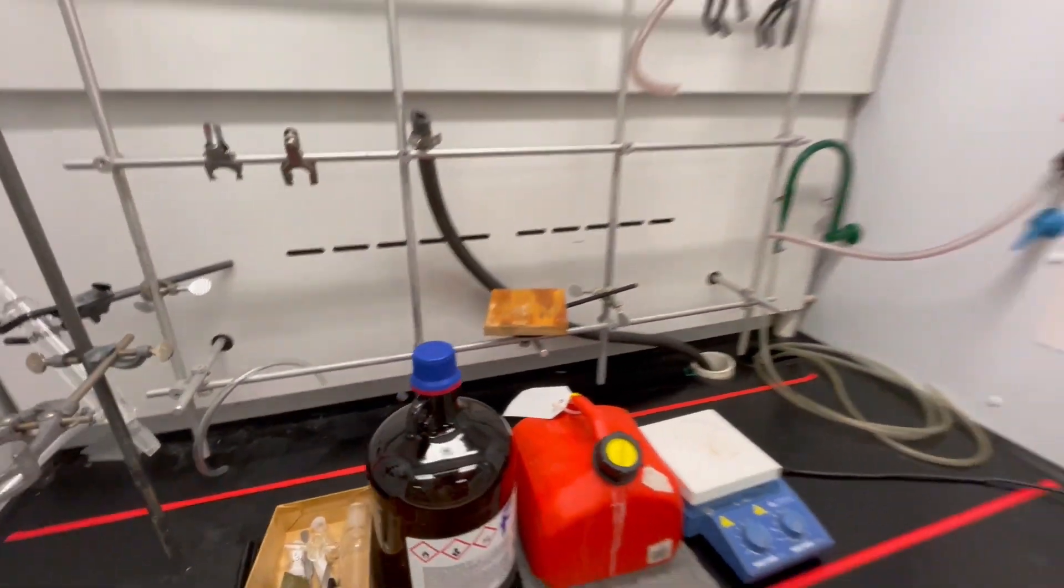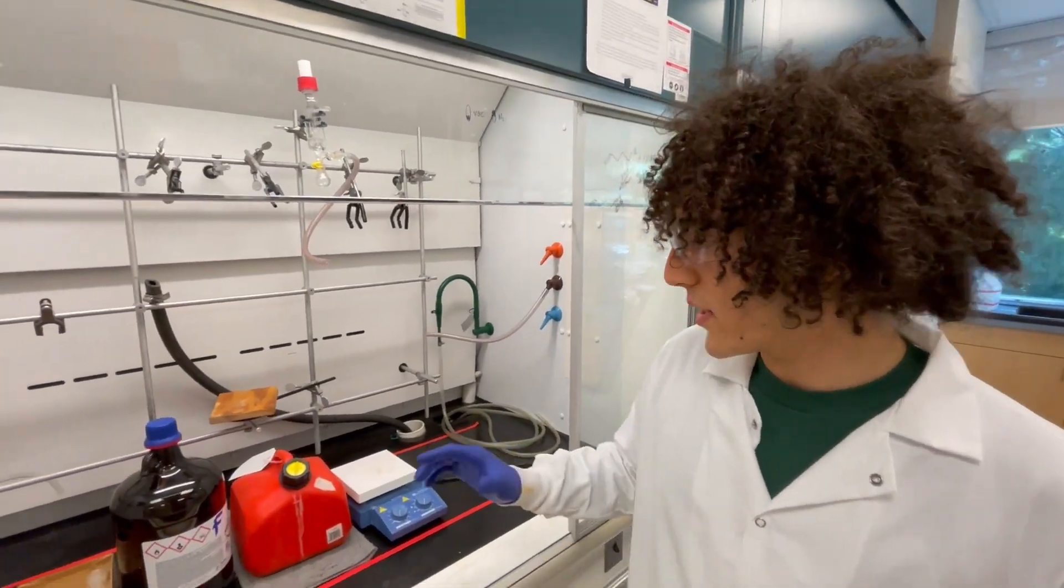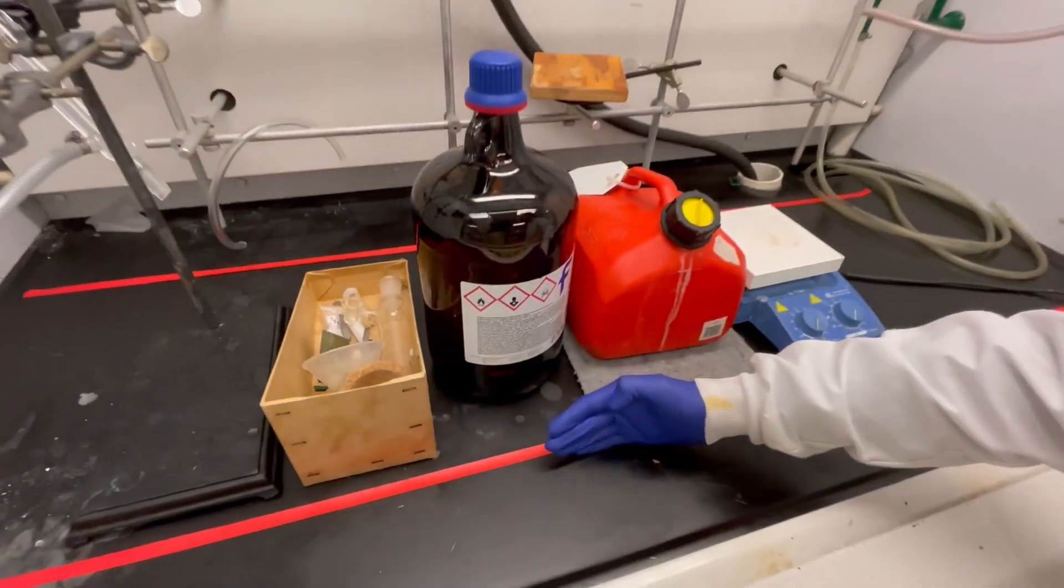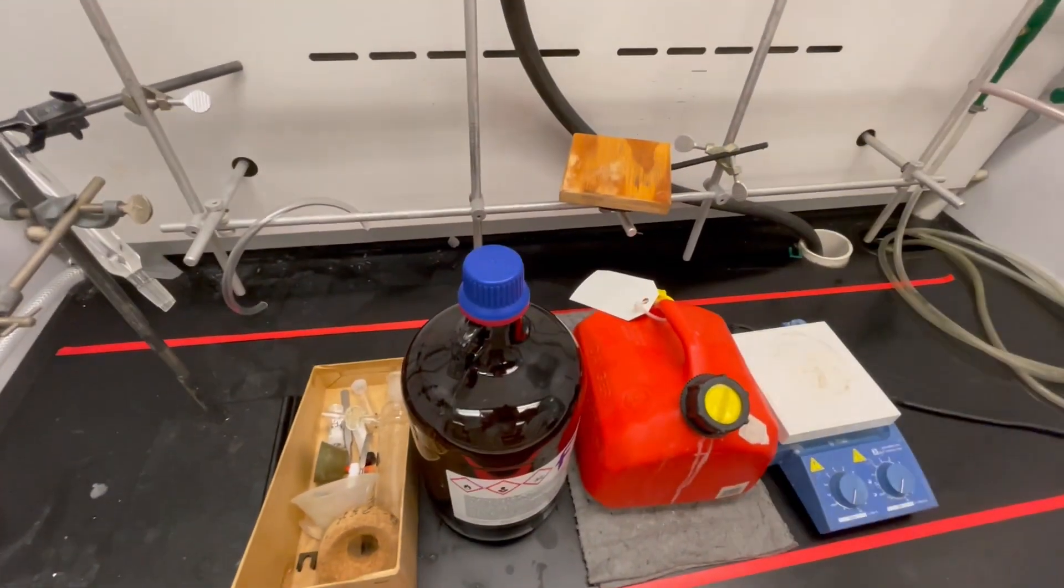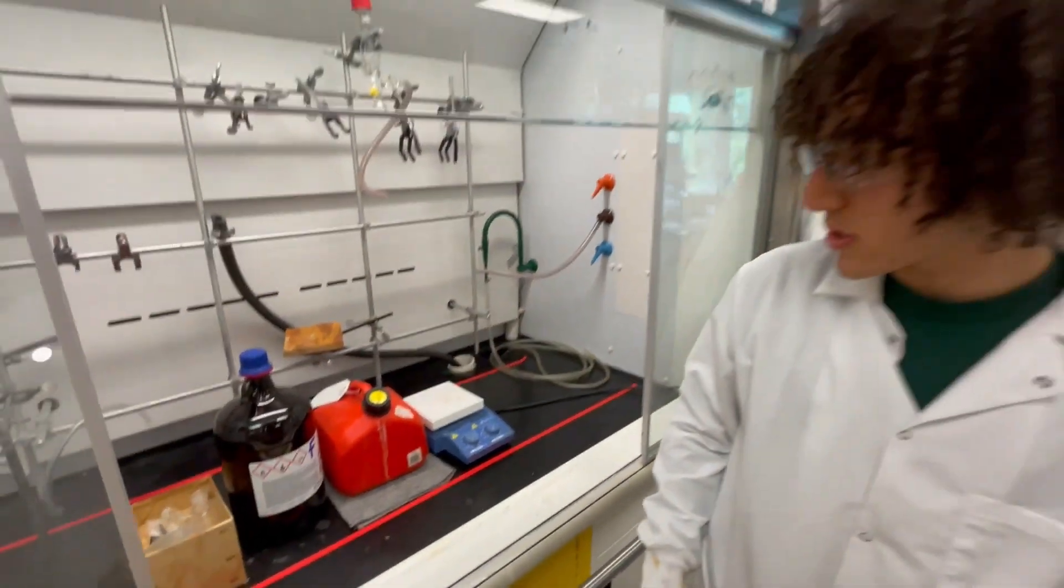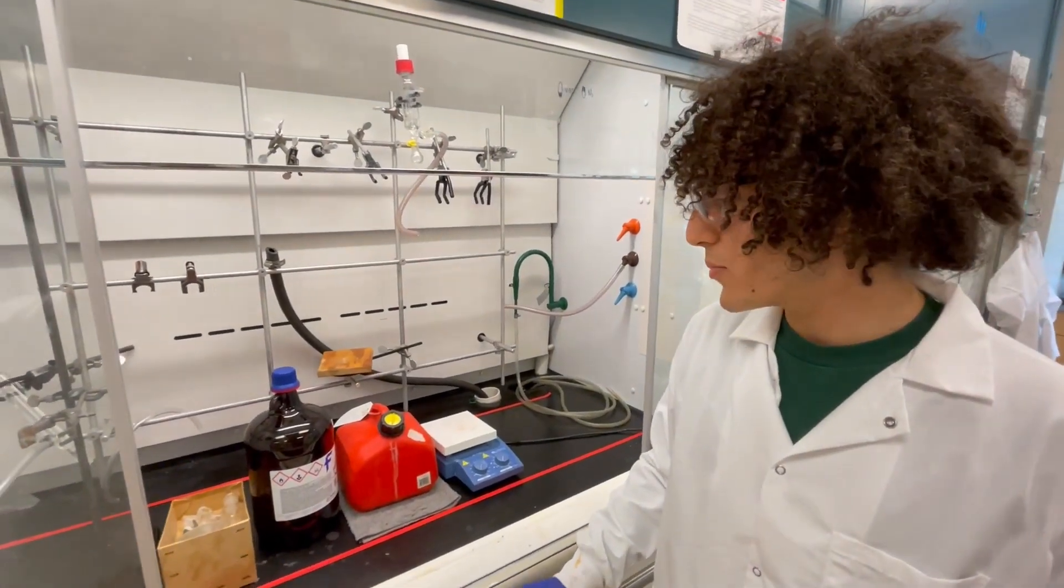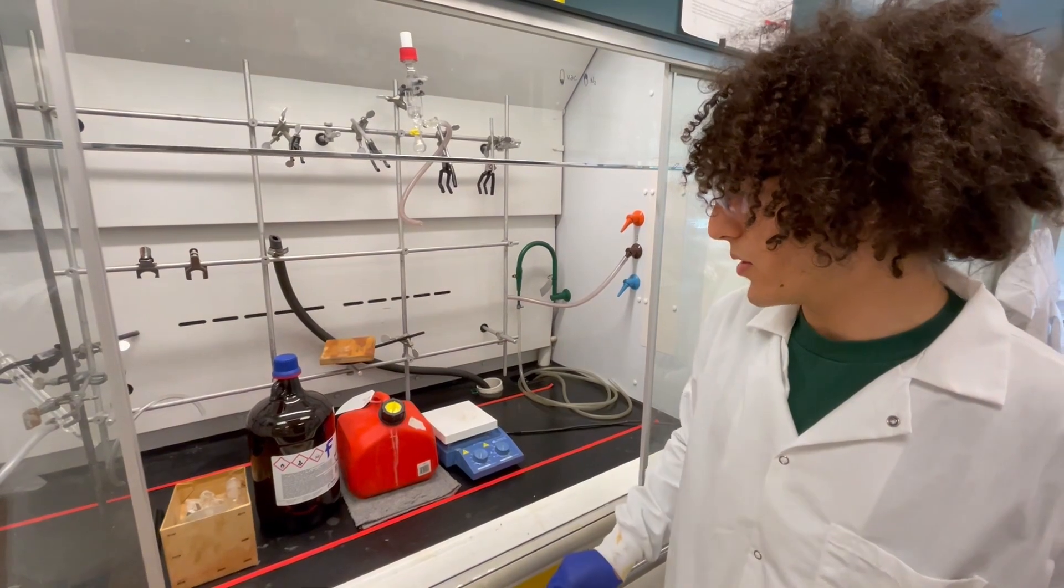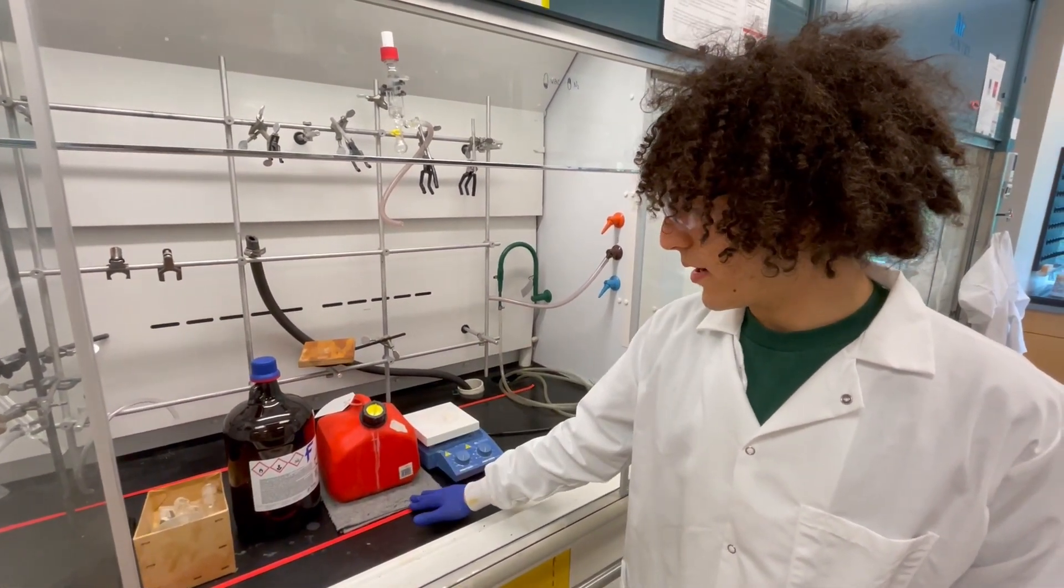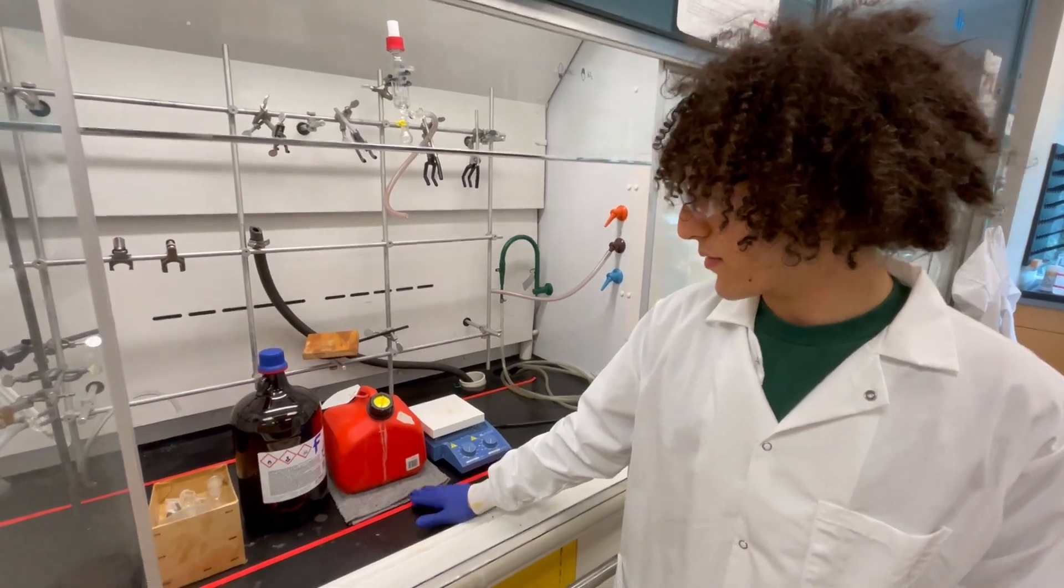To ensure that air circulation is adequate, it is imperative that all objects placed inside the fume hood are at least 15 centimeters from the front sash and the back damper, so you want to maintain everything in the central zone. Additionally, it is important to think about what objects are being placed inside of the fume hood. A very bulky object may disturb circulation and should therefore be raised.